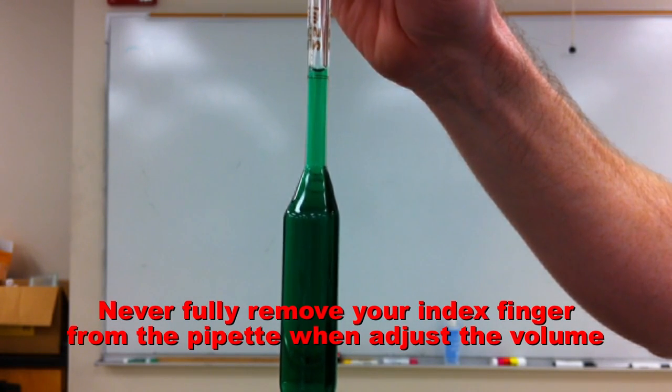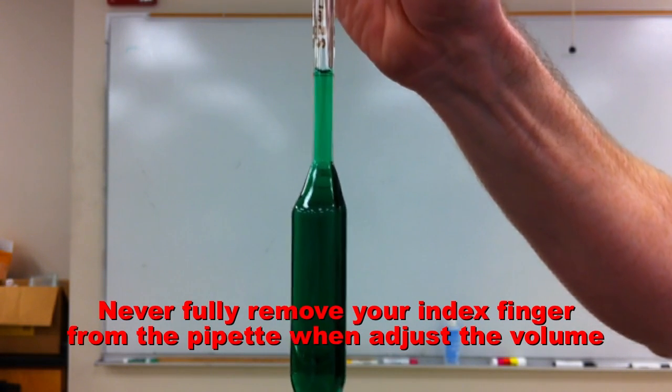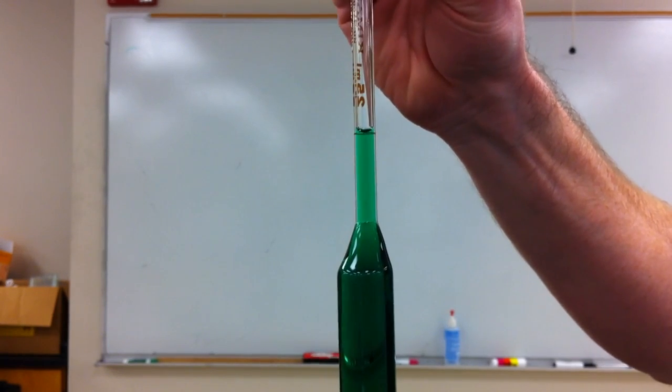Lightly release a little bit of pressure with your index finger and twist the pipette ever so slightly to control the flow of solution.